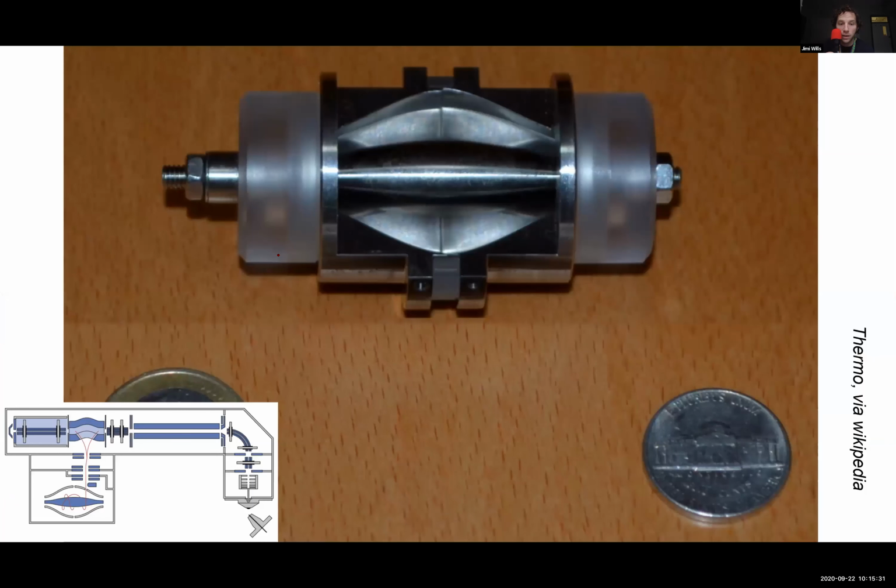And this is a vendor literal cutaway of an Orbitrap. When they make these things, it's very, very difficult to machine, and so I guess a few of them fail to make any kind of QC. And then why not cut the front off and show people what they look like inside? Anyway, the inside of this, let's say we've got positive ions coming in. The inside is negative, the outside is positive, and it causes the ions to orbit around the inside, like this.